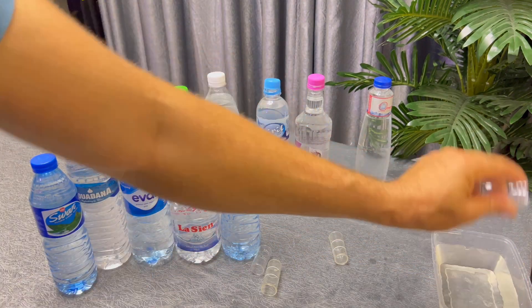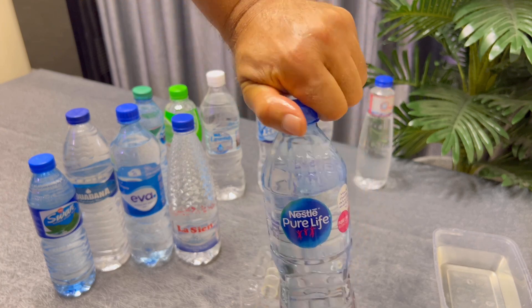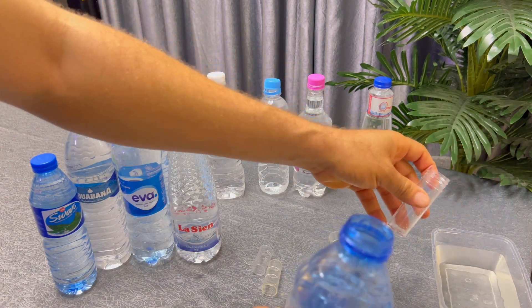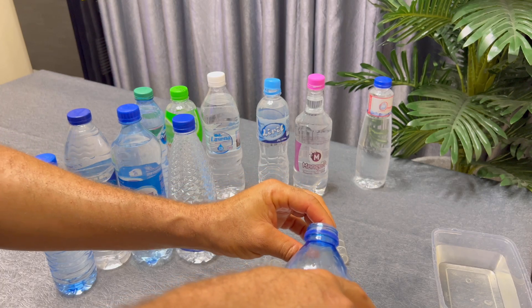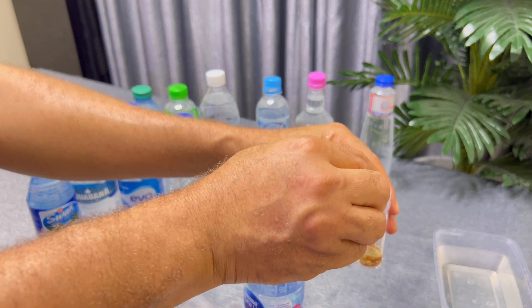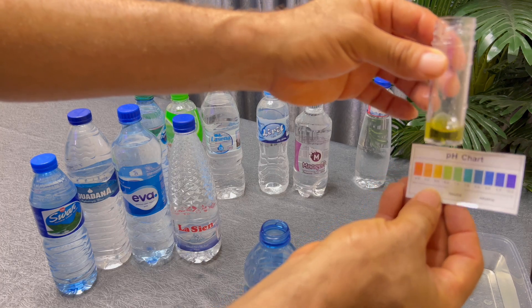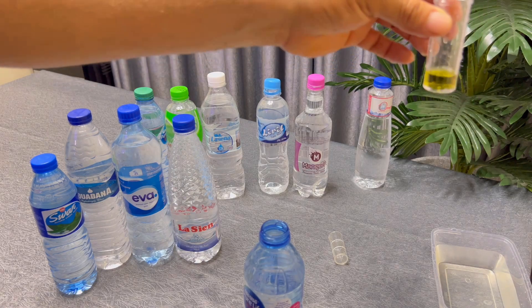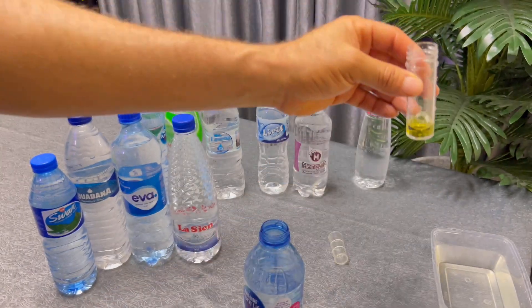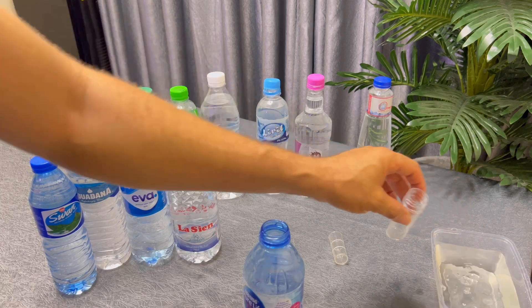We also have the Nestle water with the blue cover — I'm not sure what this one is protected with; the other one was protected with Zinc. I uncork it and rinse the test tube with it, then drop five millilitres into the test tube and add two drops of the tester. This one reads pH 6.6. It's still okay but it's 6.6, not quite up to 7. We rinse it off and take it backstage.